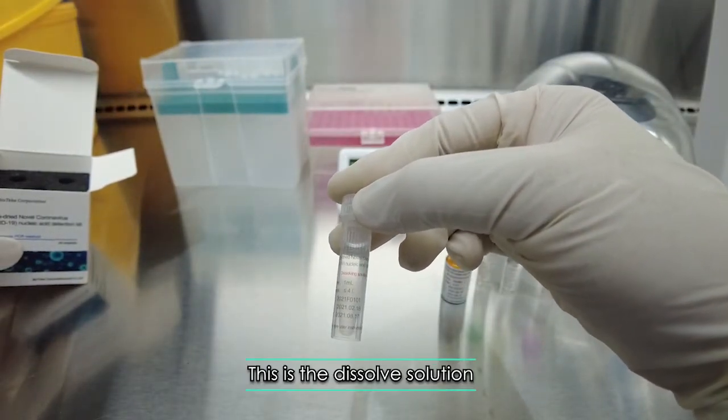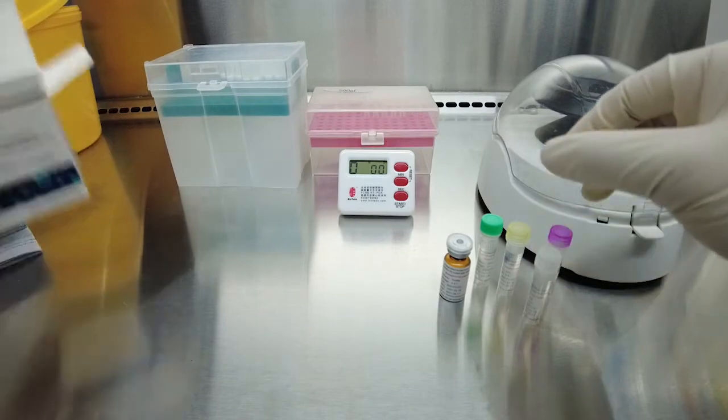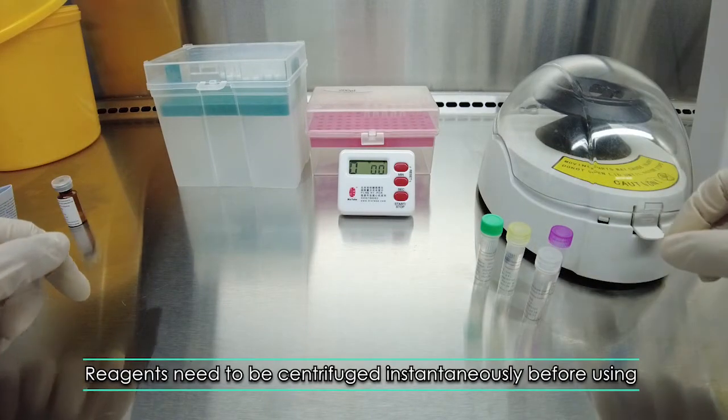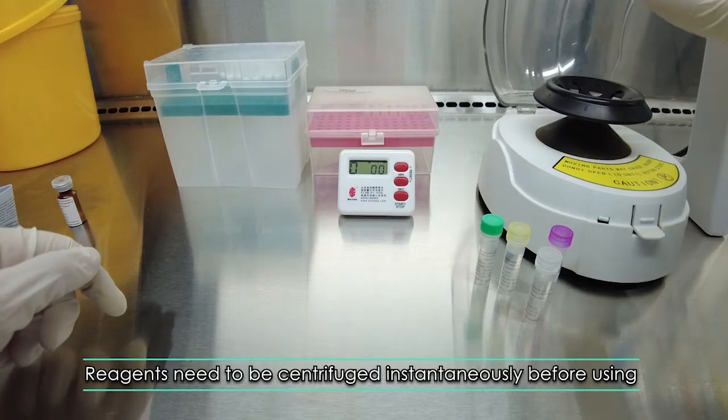This is the dissolved solution. Reagents need to be centrifuged instantaneously before using.